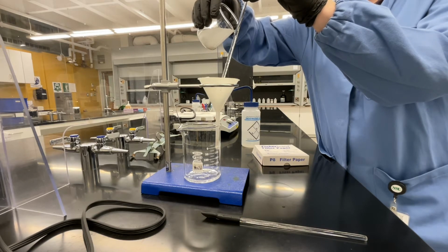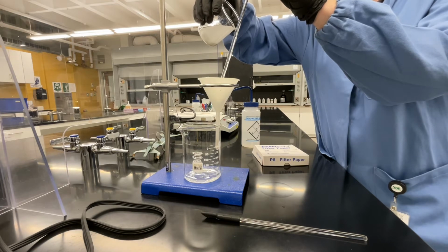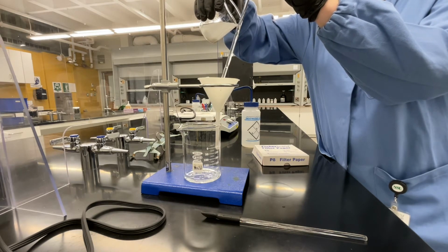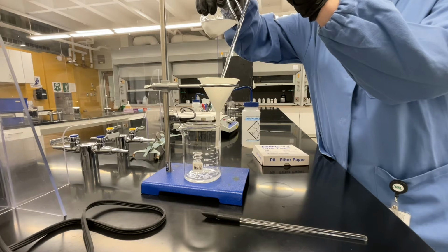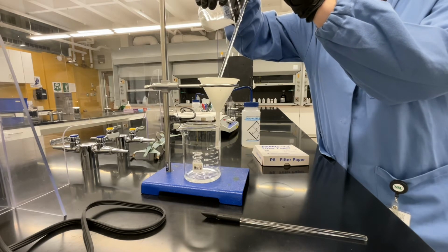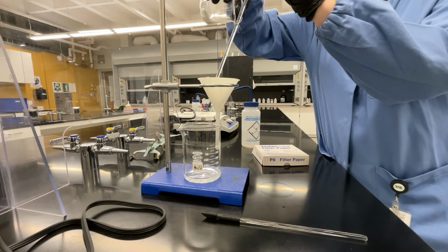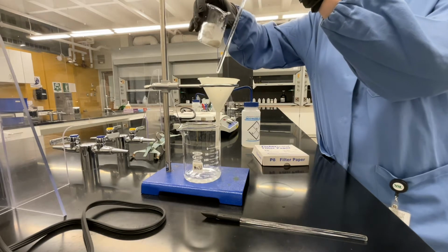The decanting process involves slowly pouring your solution down a glass rod while deliberately leaving behind the solid at the bottom of your beaker. Do this slowly and carefully, and make sure you don't overflow your funnel. During this process, you can again think about what is going on in this mixture. What substances are present in the solution, and what substances are left behind as solids? Understanding each of these steps will help you with writing your lab report and with really just comprehending what it is that we're doing with each of these steps in the chemical procedure.